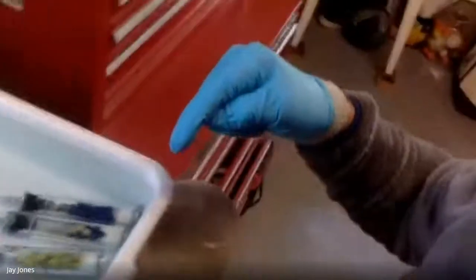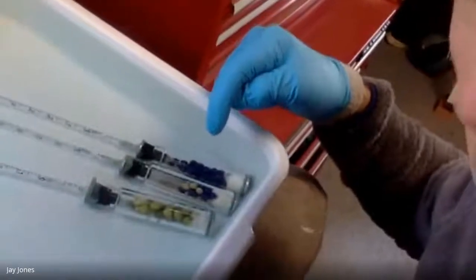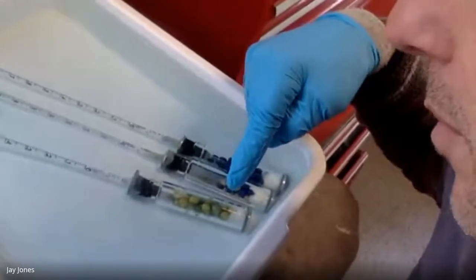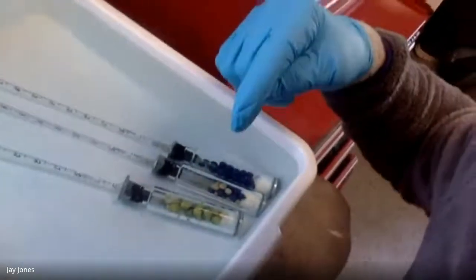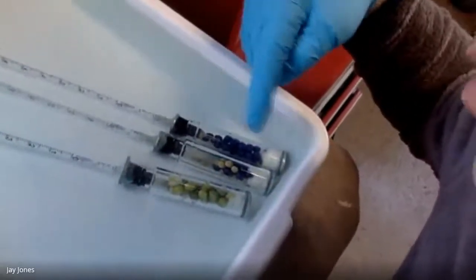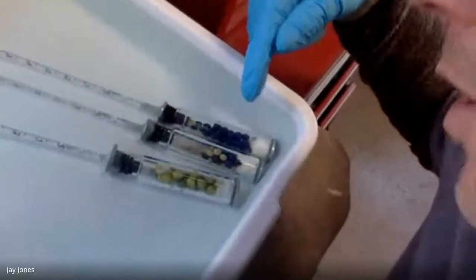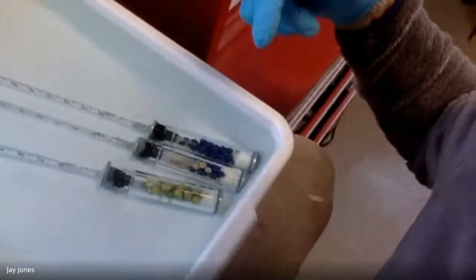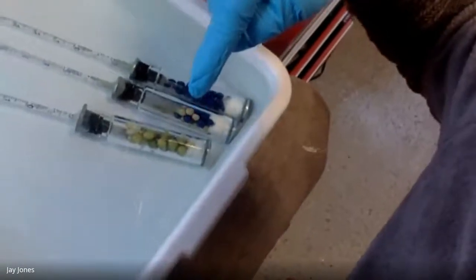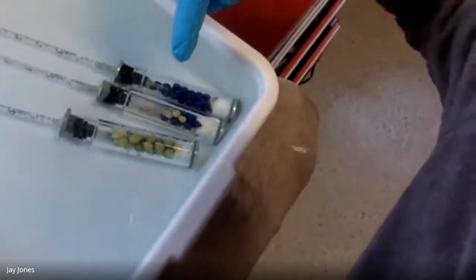We can't reliably say any changes in this germinating vial are solely due to cell respiration. We have to take out any normal changes we see in the natural temperature change and pressure change, which therefore affect the volume in the beads only. So all the mathematical readings we take from the germ, we're going to subtract from those readings, those differences, these differences in the beads. The beads will tell us the differences. The beads are arguably the most important ones here.